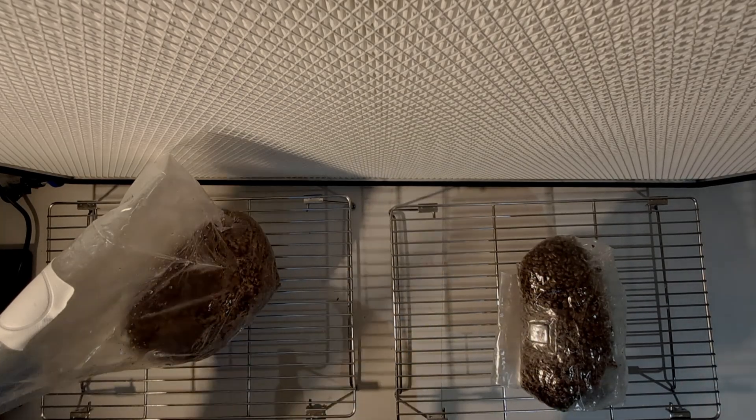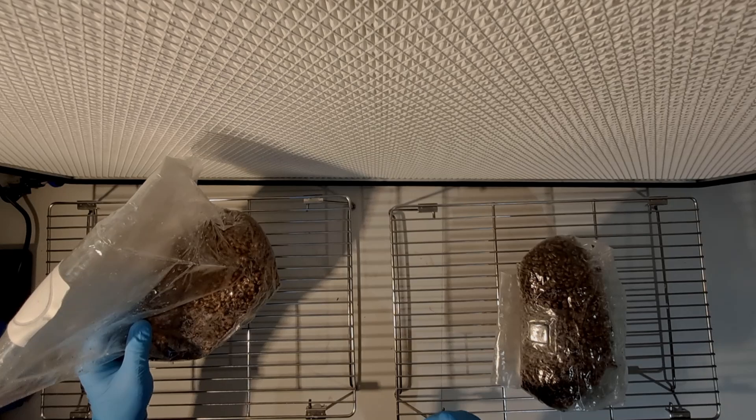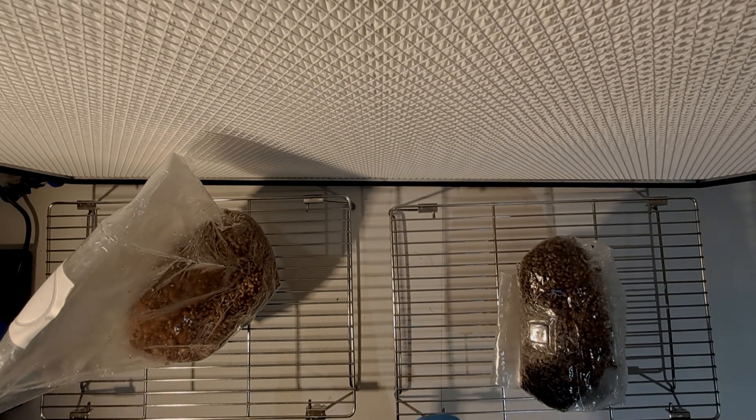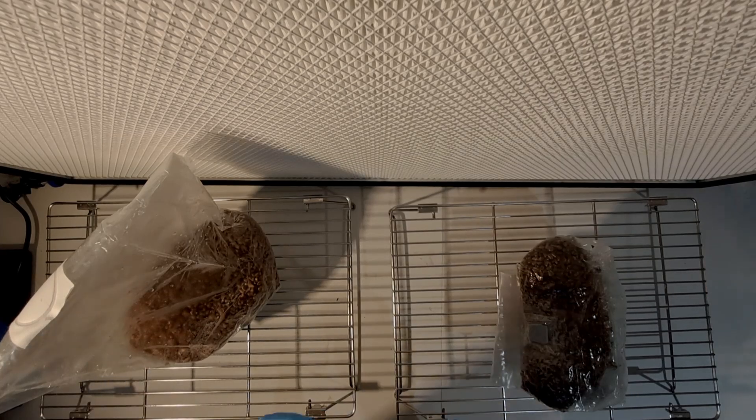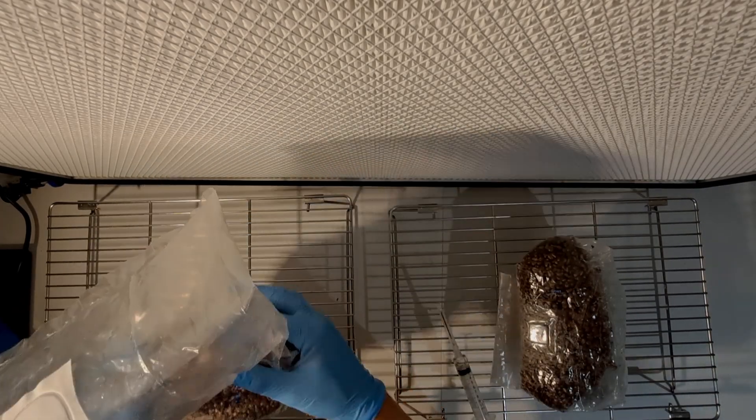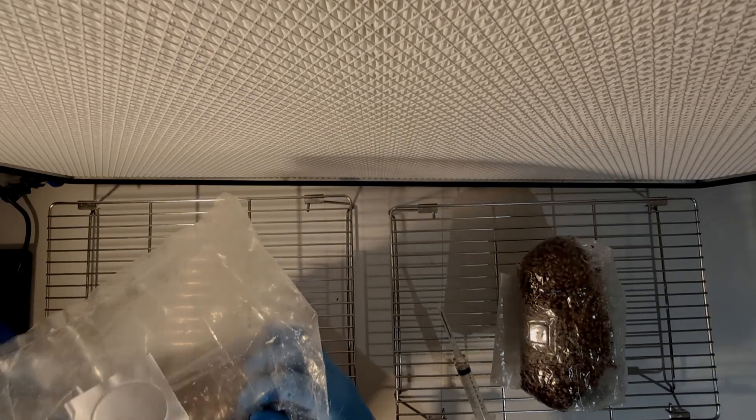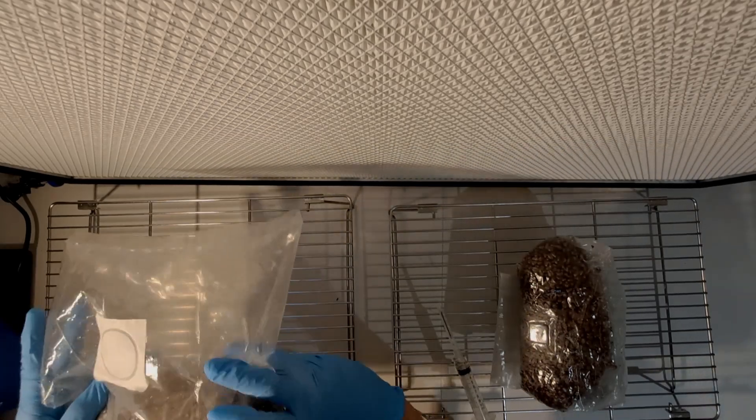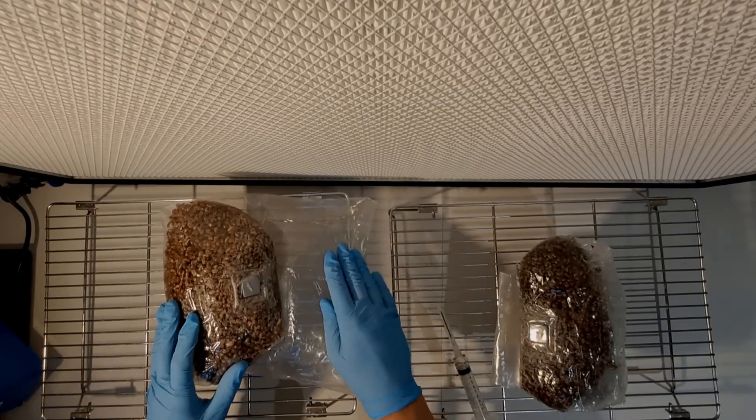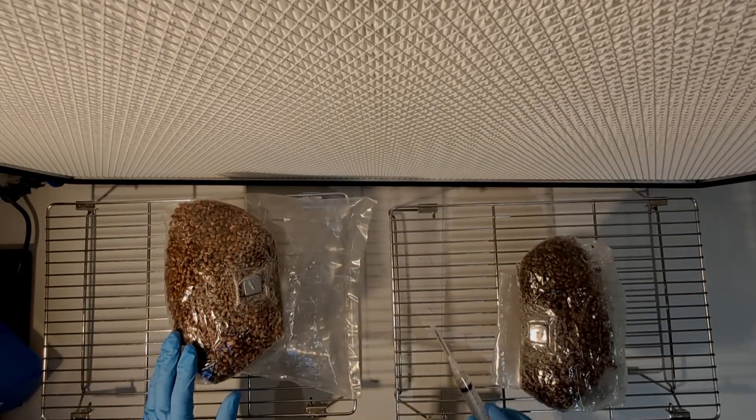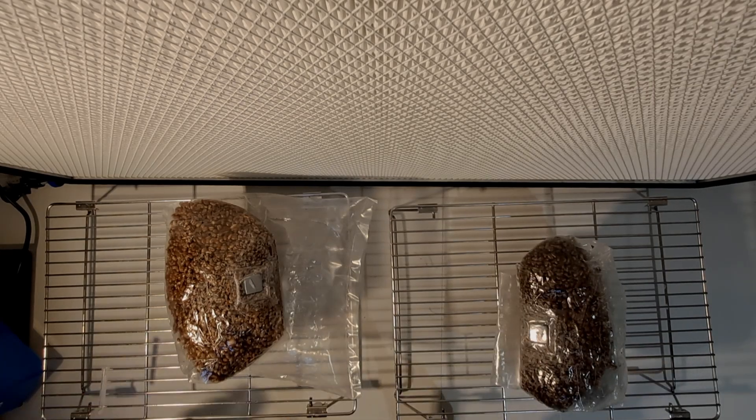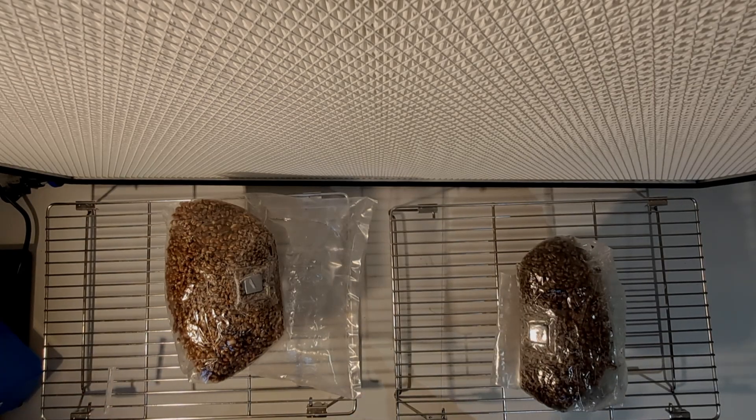Hold the syringe in its own airflow and then move on to the next bag. I haven't positioned my bag in the best position to just go and do the next inoculation so I probably should have organized my workspace a little bit better before starting the inoculations. Same position again with the second bag, flame sterilize the needle and inject the liquid culture.